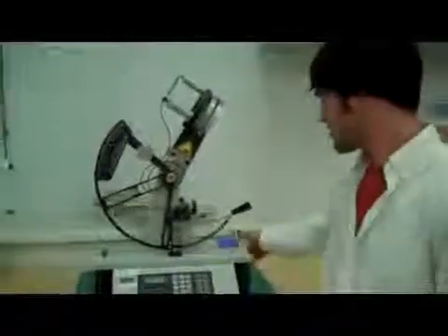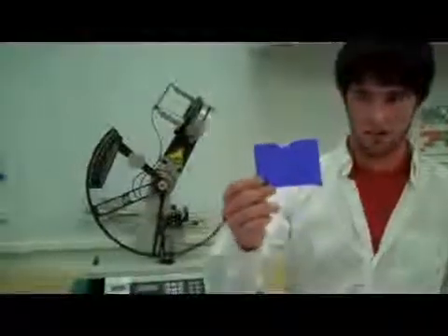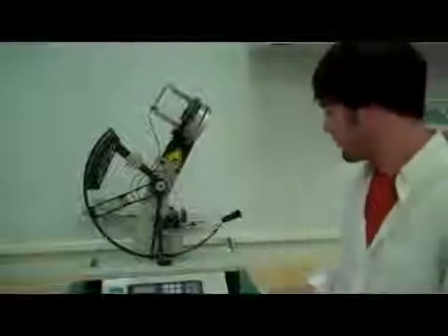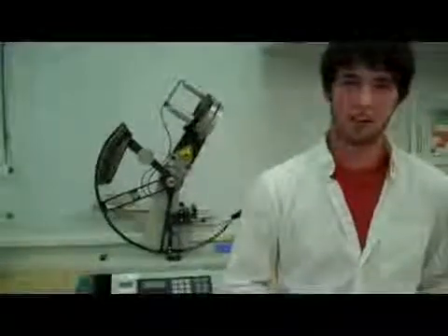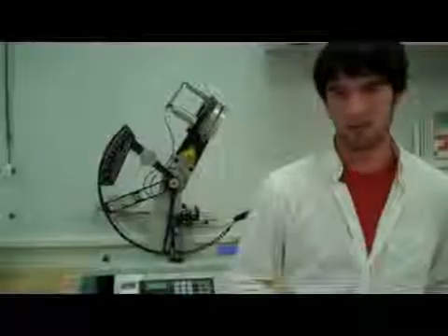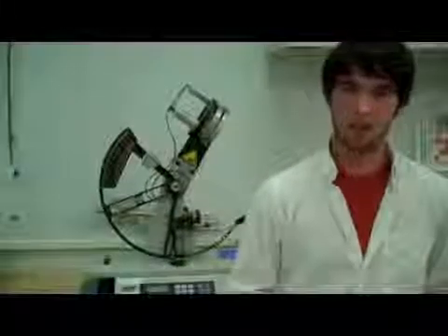Typically your samples are 2½ by 3 inches, or in some instances when testing textiles, you use a die to cut your sample. And typically you want to test samples in both the machine and the transverse direction, which are basically perpendicular directions when the sample comes out of the extruder.